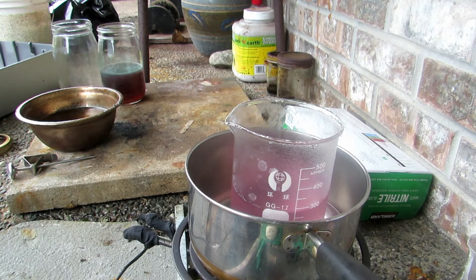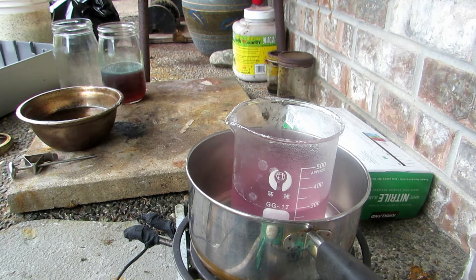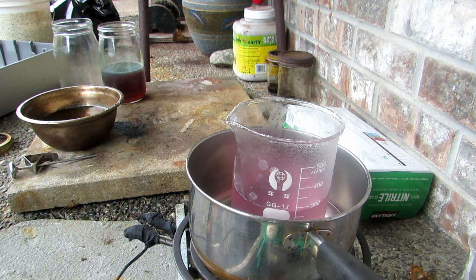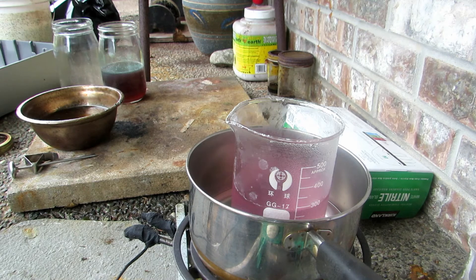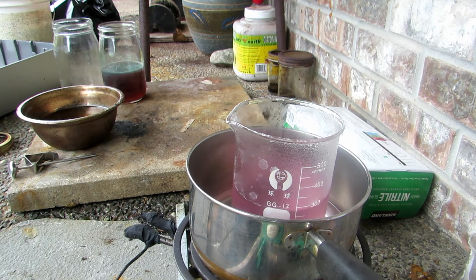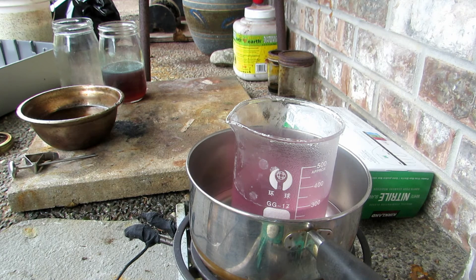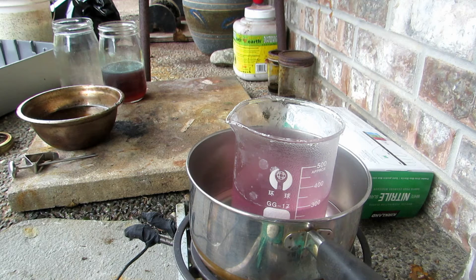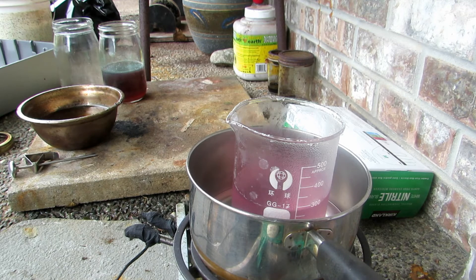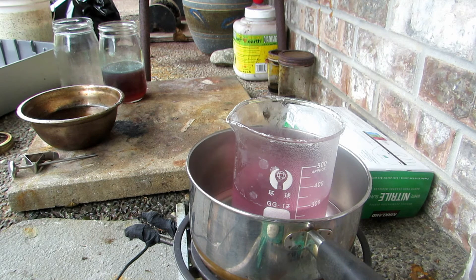We'll let the methanol evaporate off until it's all boiled off. When it becomes a very saturated solution it may also be possible to cool it down really cold and recrystallize the acetylsalicylic acid, since solubility decreases rapidly with temperature. That could remove the pink color, though it would decrease our yield. I think I'll do a recrystallization and then let the rest of the solution evaporate off.